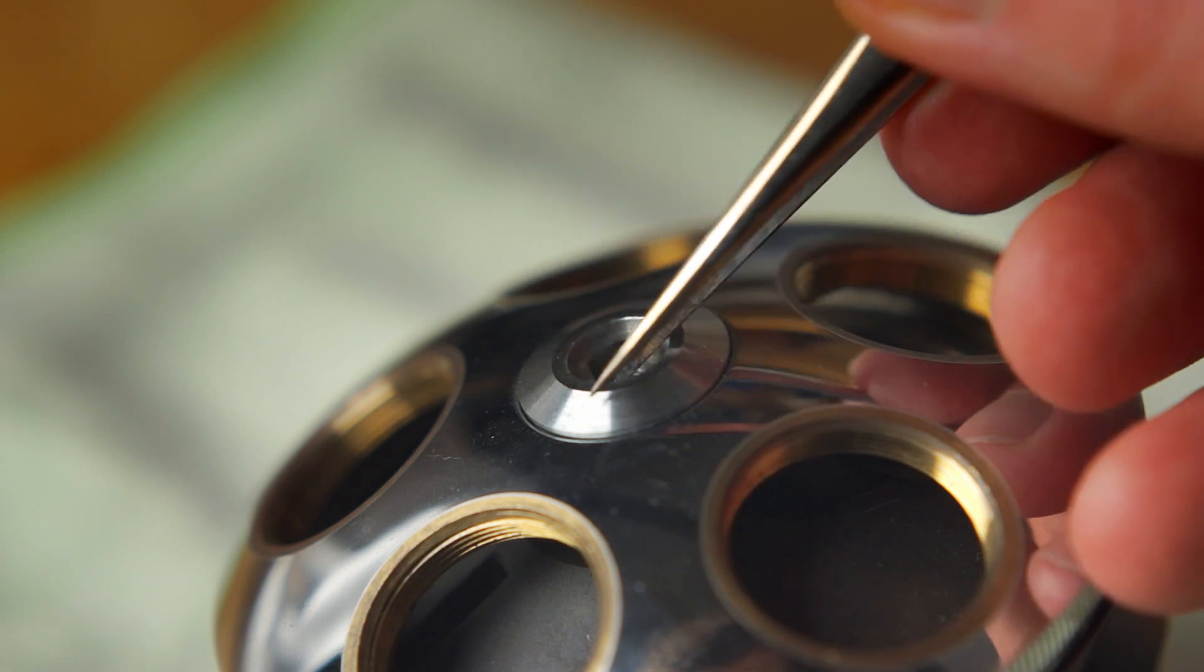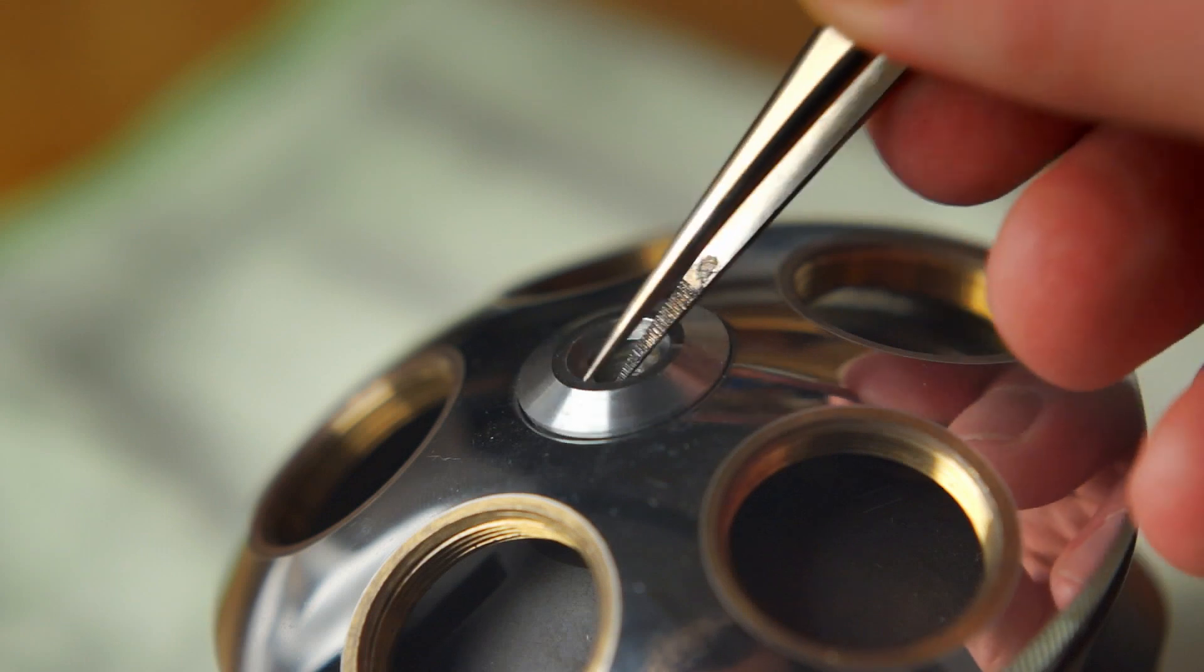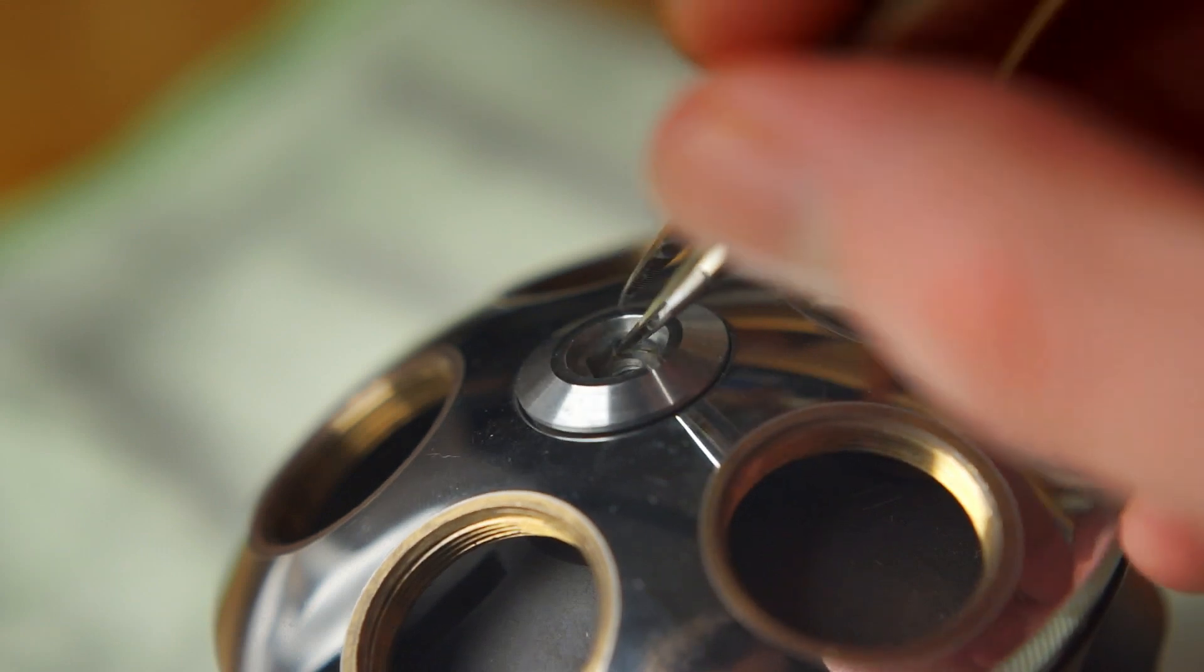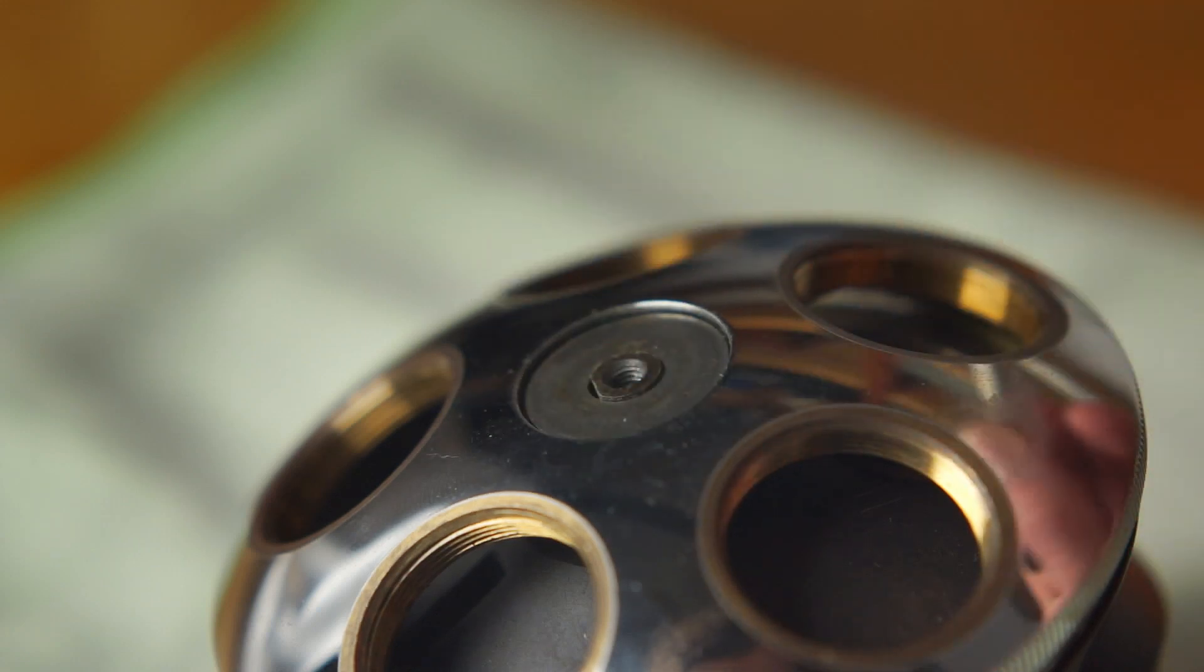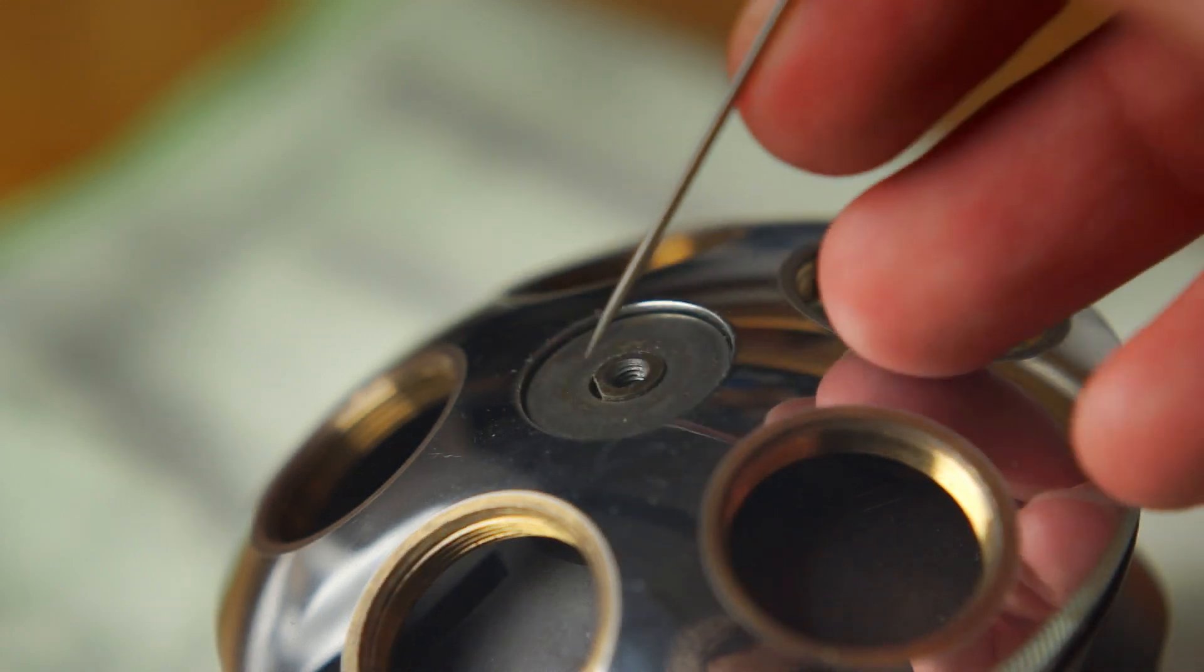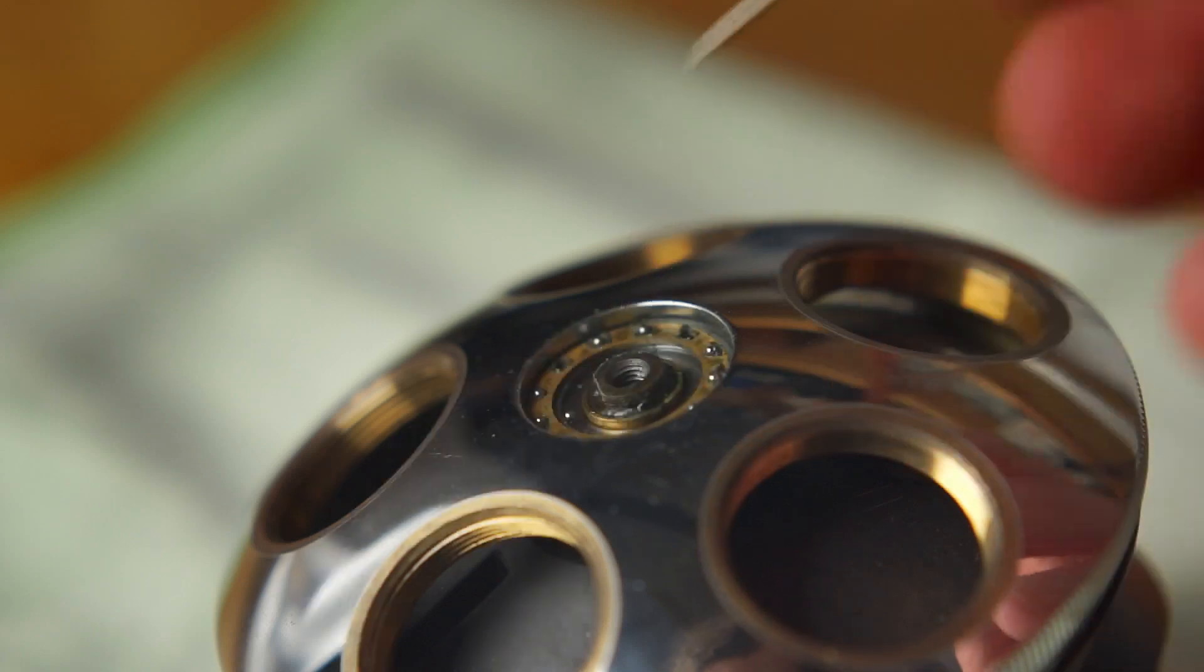Next, the washer is removed. This can be rather tricky at times. This frees up the upper bearing race, allowing its removal.